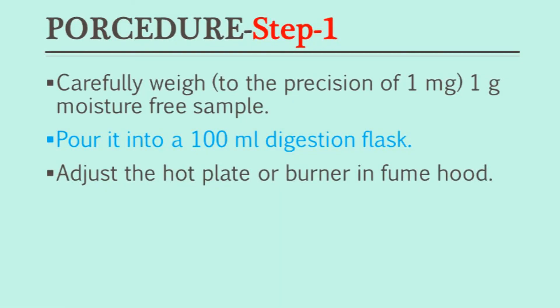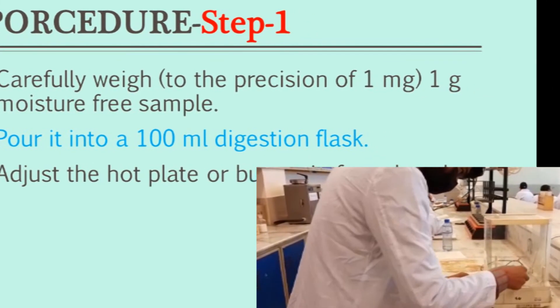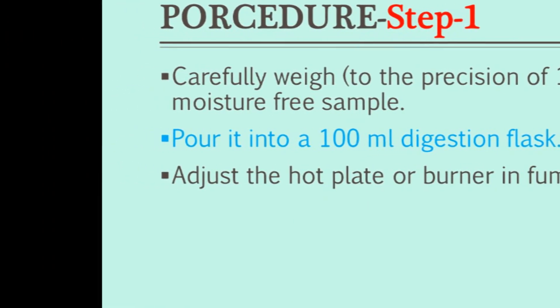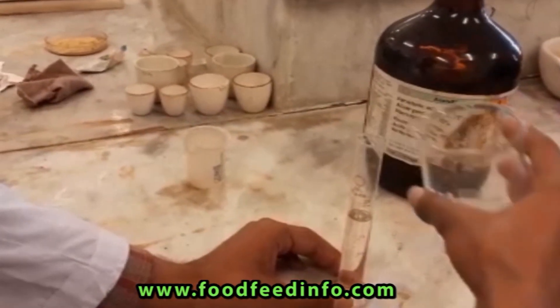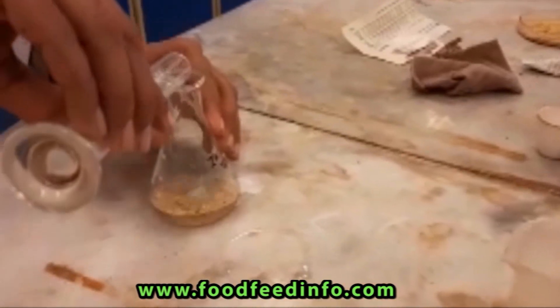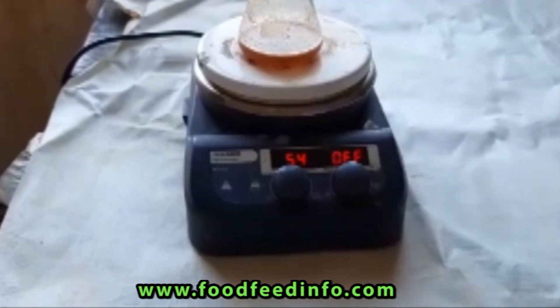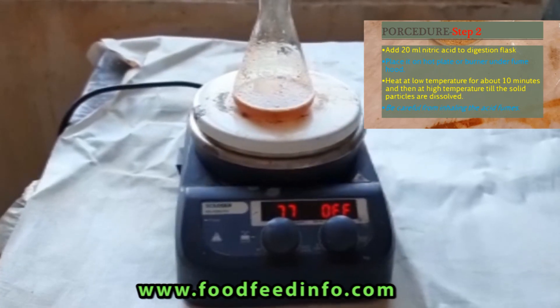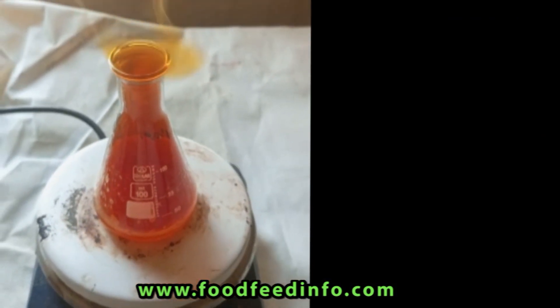How to perform the experiment: Carefully weigh to a precision of 1 milligram a 1-gram dry, moisture-free sample and pour it into a 100 ml digestion flask. Adjust the hot plate or burner in a fume hood. Add 20 ml of nitric acid to the digestion flask and place it on the hot plate under the fume hood. Heat at low temperature for about 10 minutes, then at high temperature until the solid particles are dissolved. Be careful not to inhale the acid fumes. Remove the digestion flask from the hot plate and let it cool.